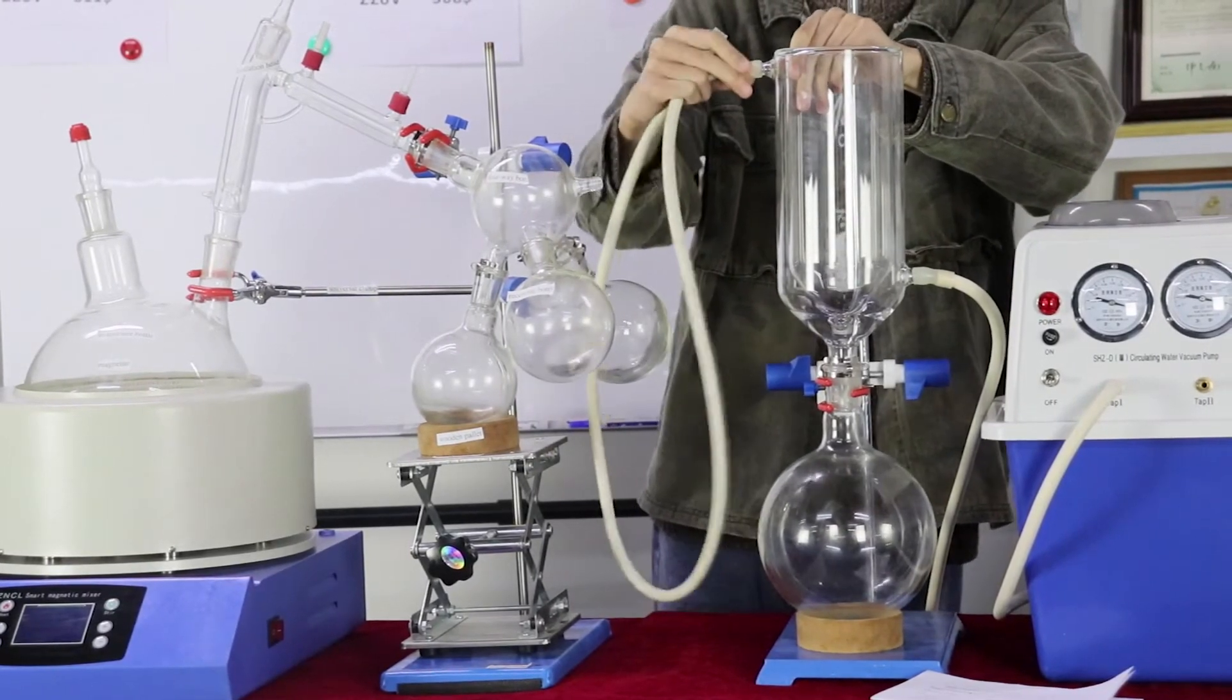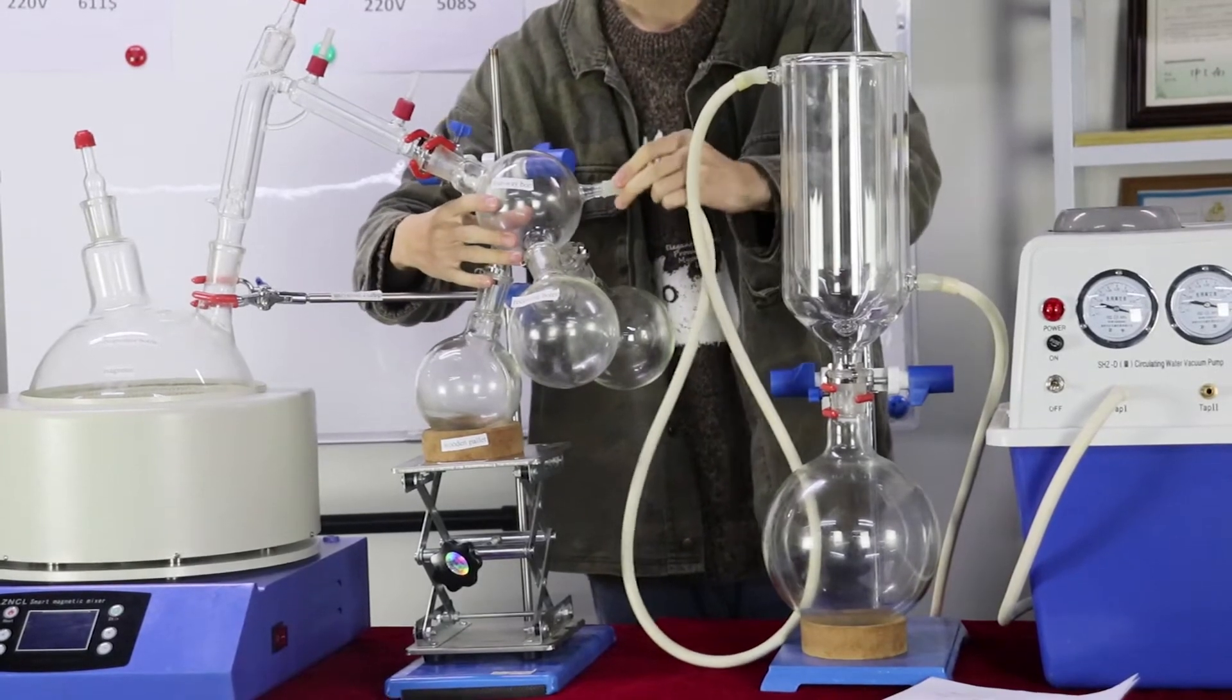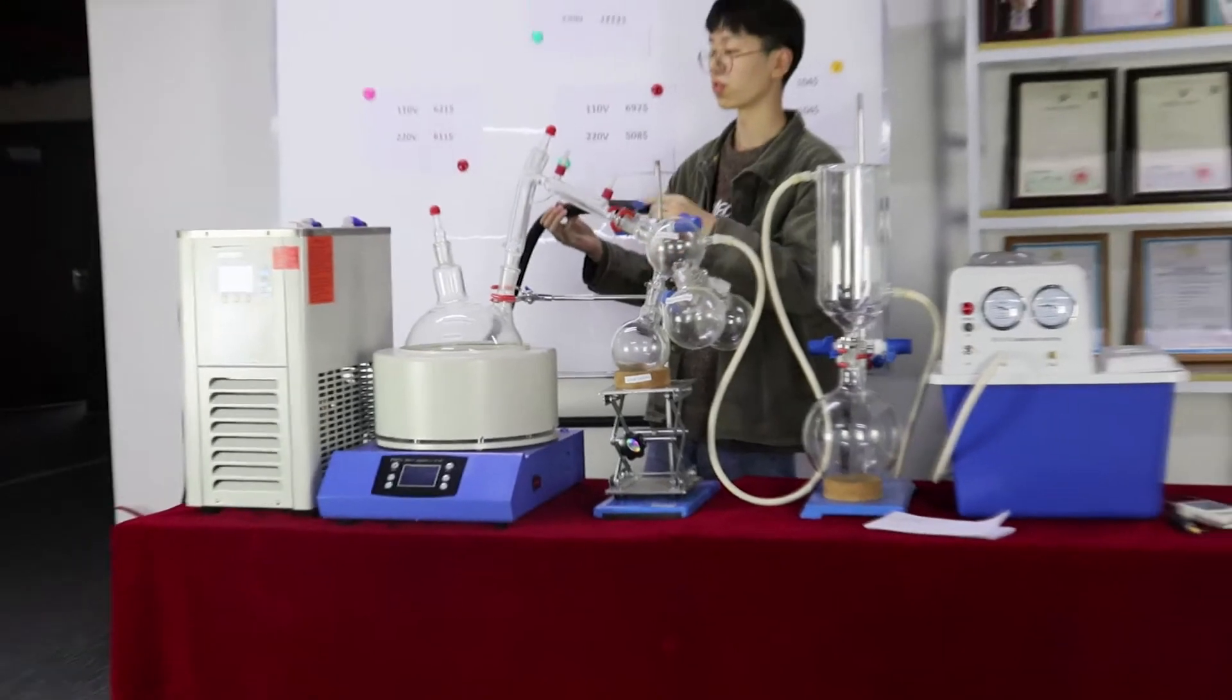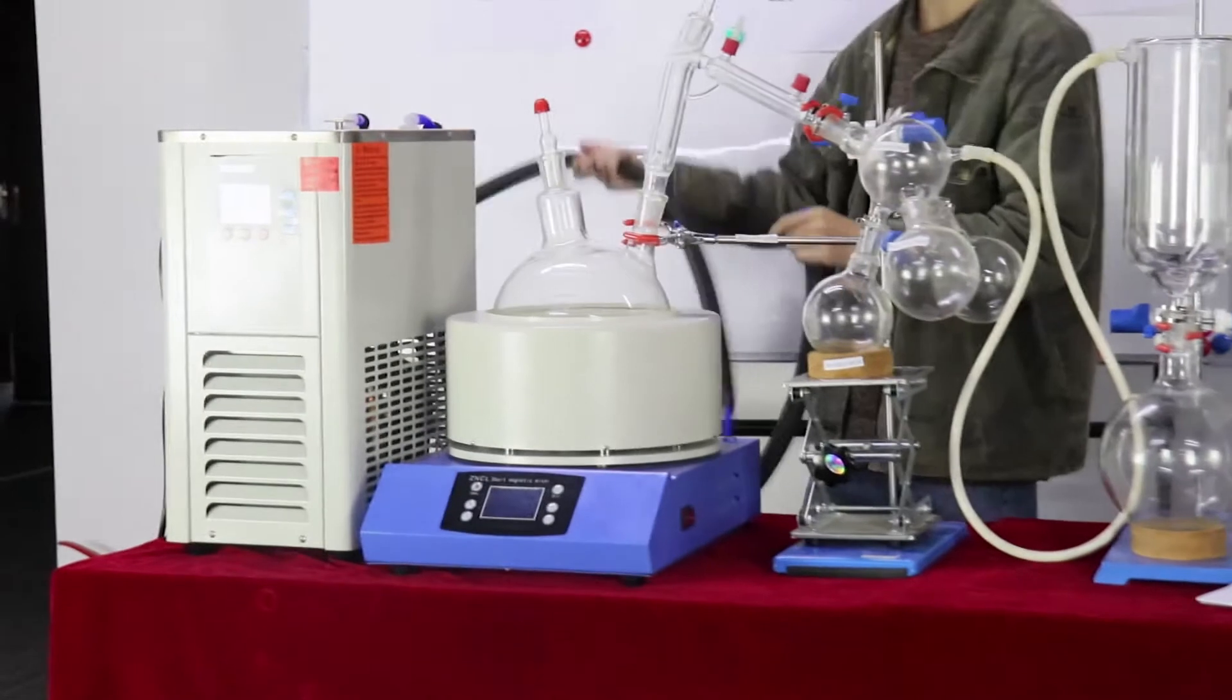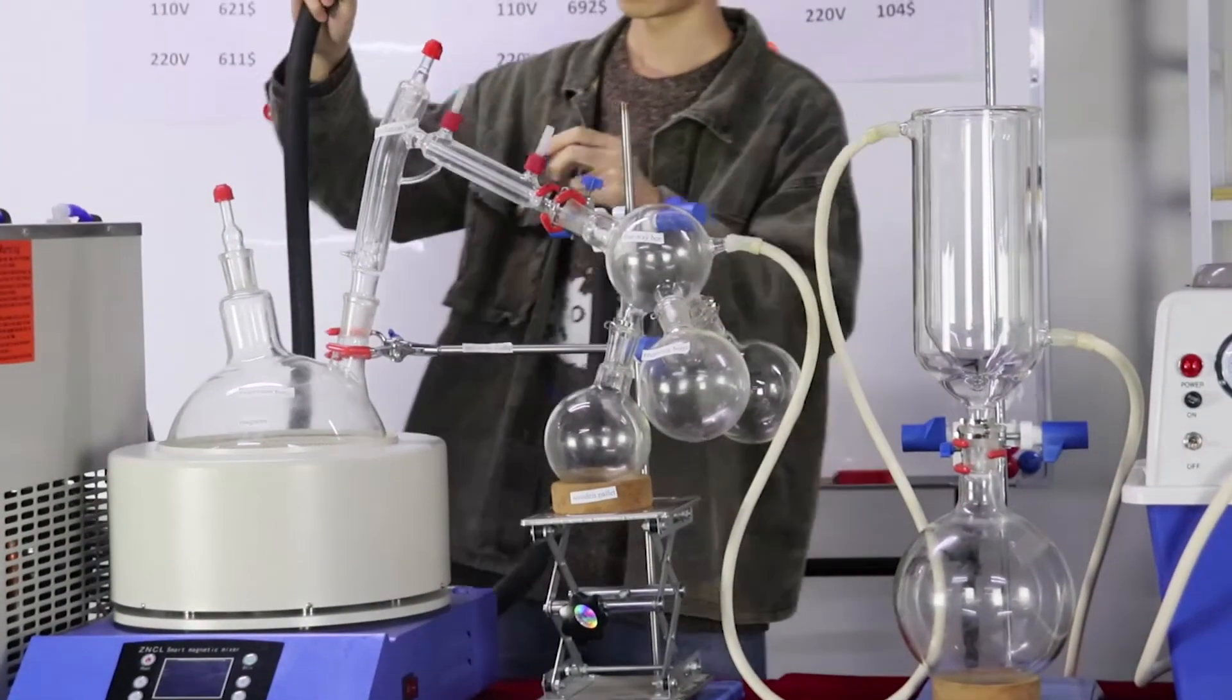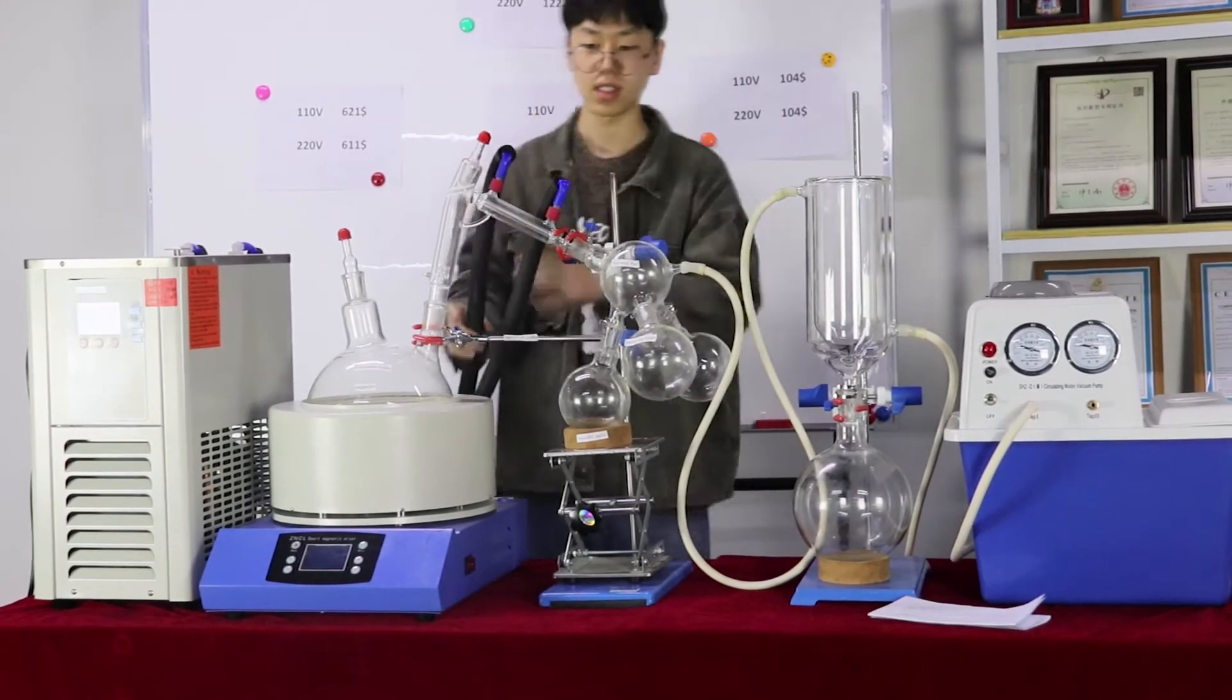I need to connect the cold trap to the condenser. Okay, this is now connected.